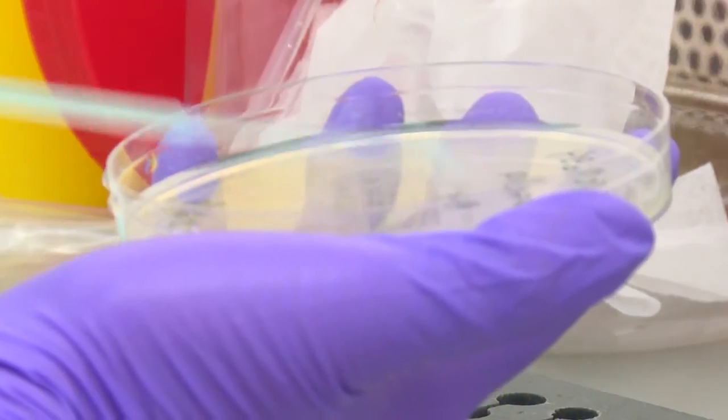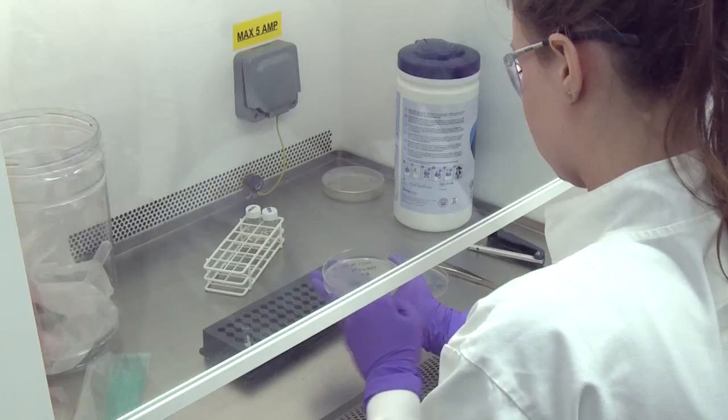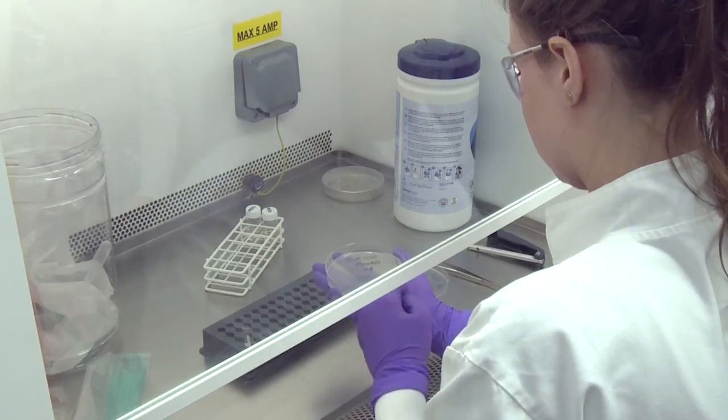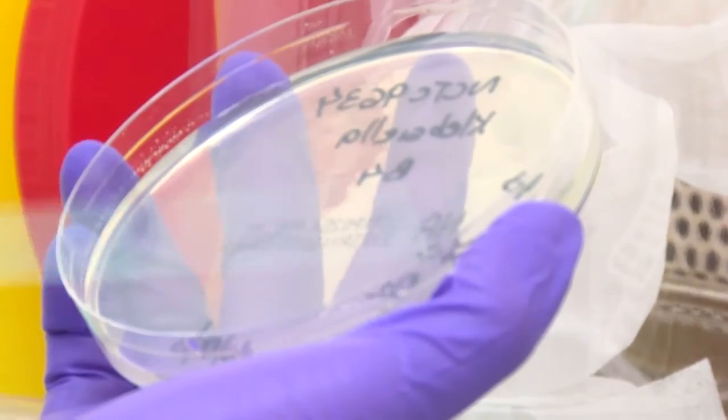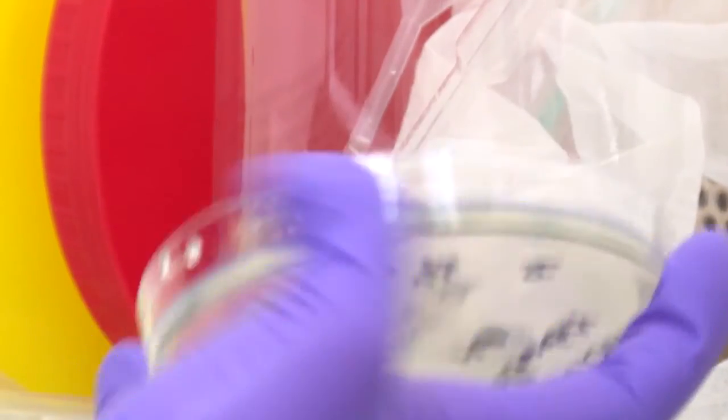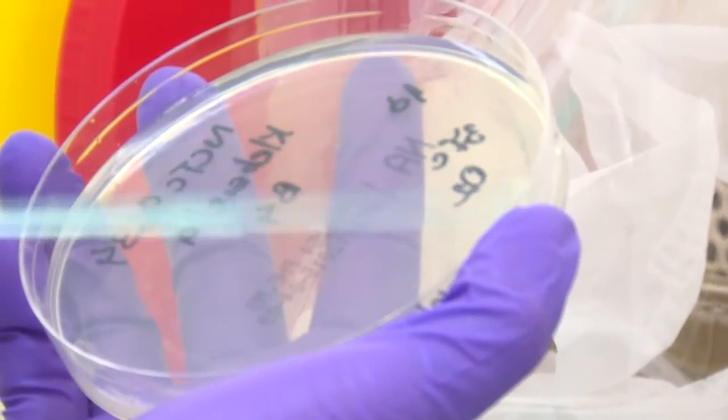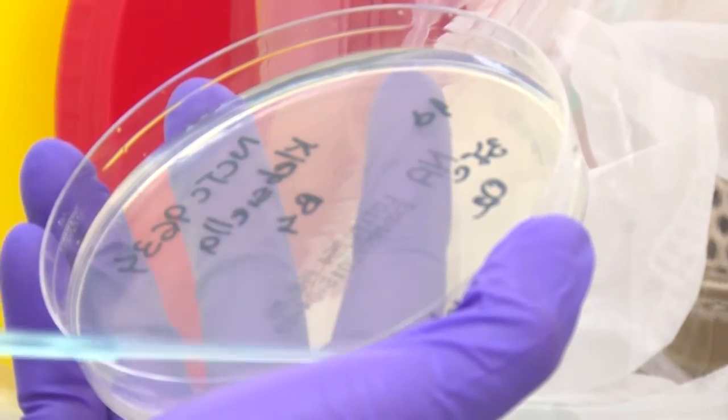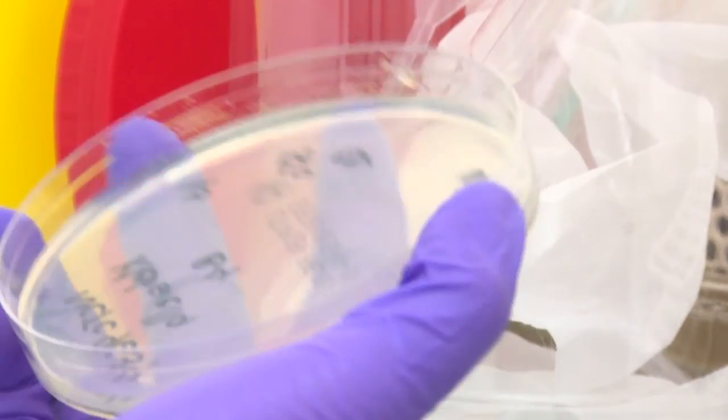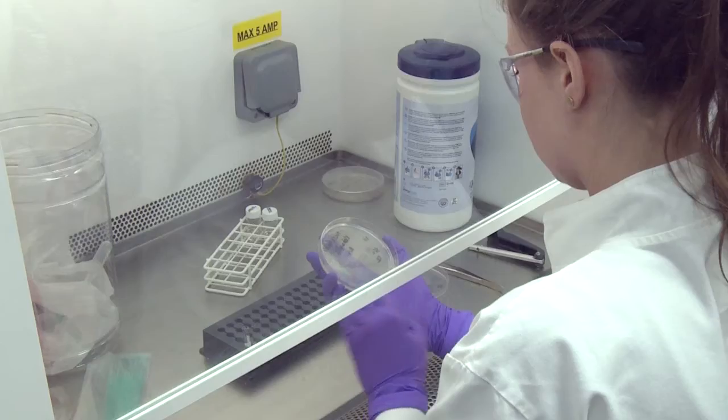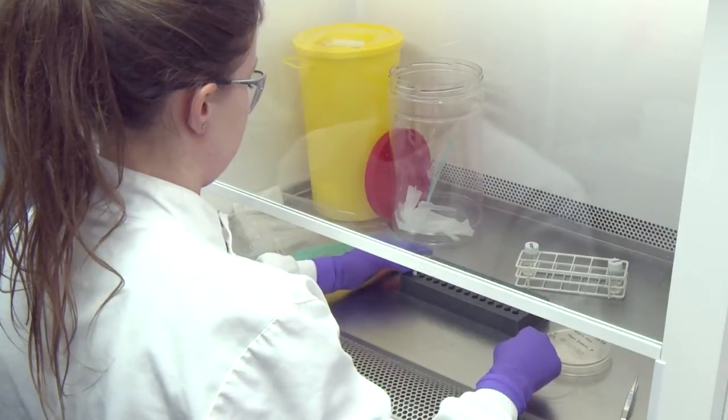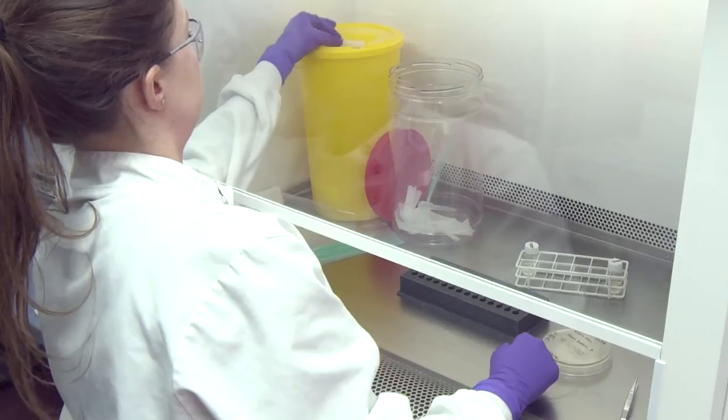This is to obtain both single colonies and to detect aerial contaminants which may be introduced during the opening of the ampoule. Discard the used ampoule into a sharps bin.